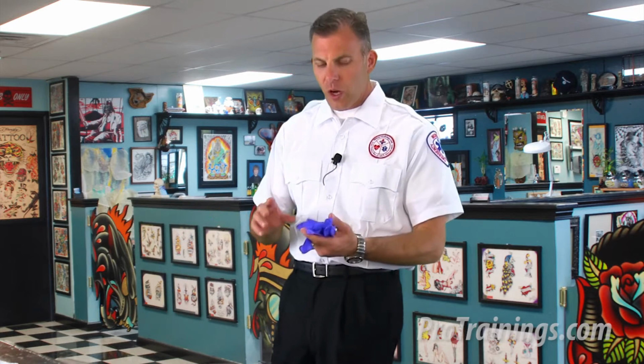Now we're going to talk about how to disinfect contaminated work surfaces. There are several things that we're going to start with. First of all, there are certain materials you've got to have present to be able to do this properly. Personal protective equipment is of the utmost importance. So if you think there's a chance that you're going to get a splash in the eyes or get it on your clothing, you need to have personal protective equipment equivalent to what you're going to need to do.